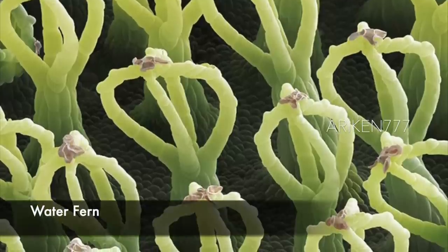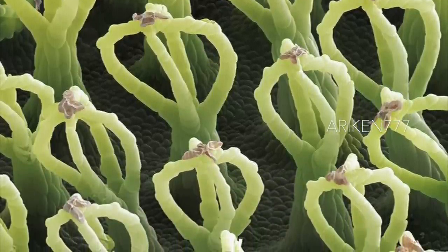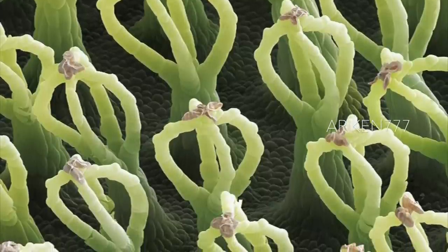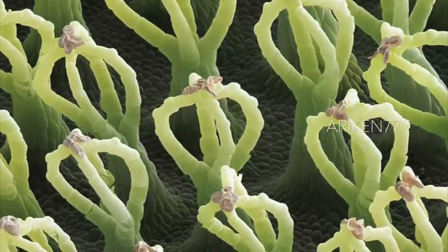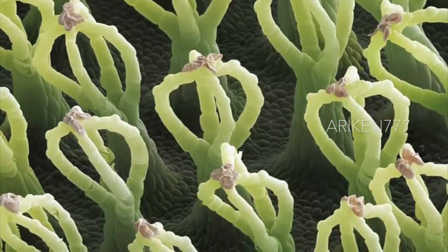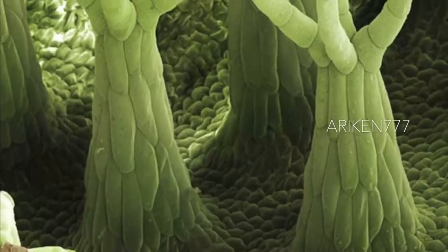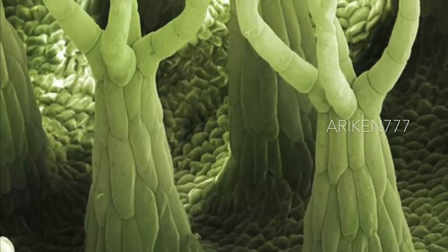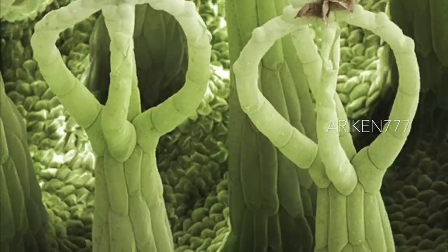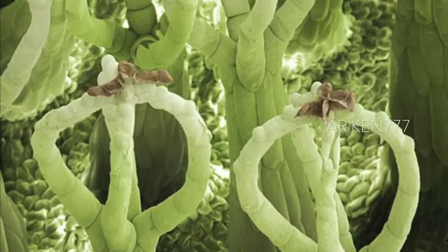These are water-repellent hairs found on the leaves of water fern. Each hair, approximately a millimeter in length, is designed to trap a thin layer of air between the leaf and the surrounding water, thus increasing the plant's buoyancy and stability. This aquatic plant is considered an invasive pest, owing to its ability to grow quickly into thick mats up to two feet deep that essentially extinguishes all life in the depths beneath them.